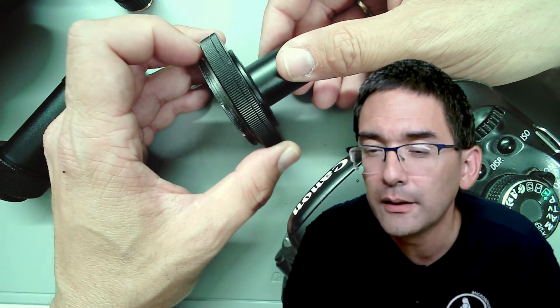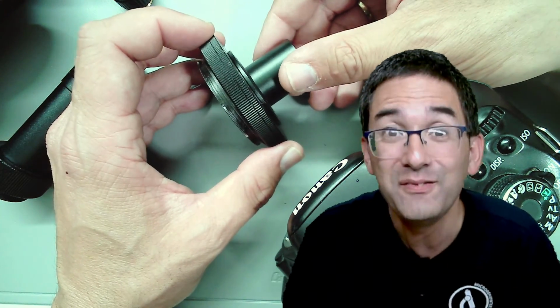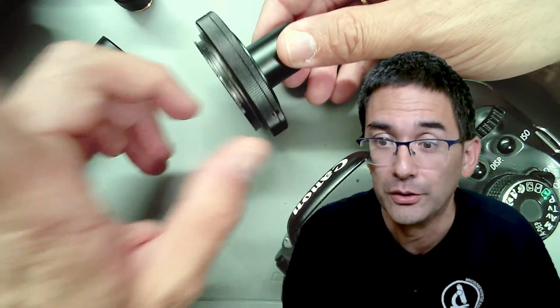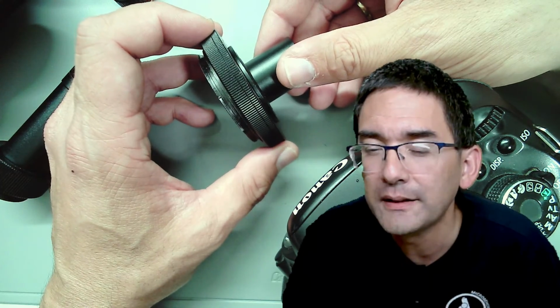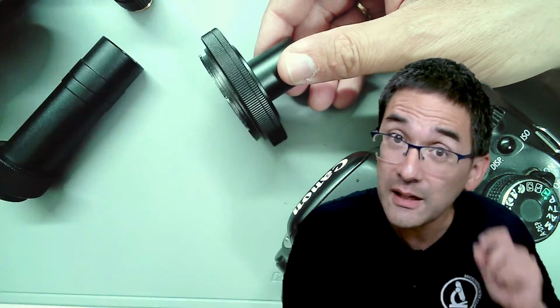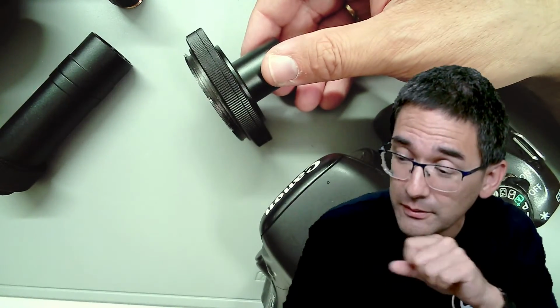Have you tried a 3D print? Yes, I have tried 3D printing. I made videos on this, and I will show you a 3D print later. Have you tried 3D print adapters? If so, can we find the CAD file? If you want, I can make an STL file available for the Swift Stellar microscope.